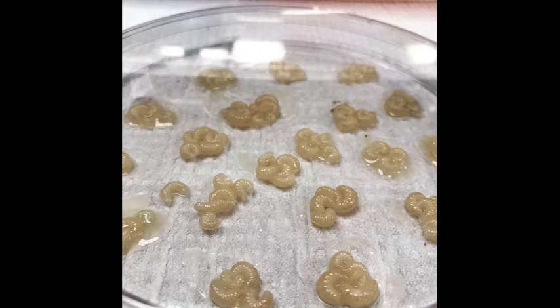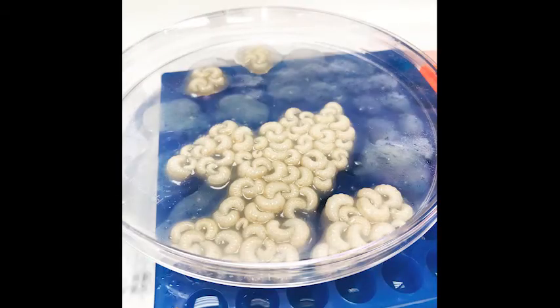These bees are slightly more mature. The eyes have started to darken. You can see a close-up again. And we can use these pupae for lots of different types of experiments. In this one, we were just seeing if we could get them to emerge. And then here's what they look like as they're getting much closer to being an adult bee. Here we can see they're darkening. The coloration pattern is there, but they still don't quite look like they're ready to emerge.